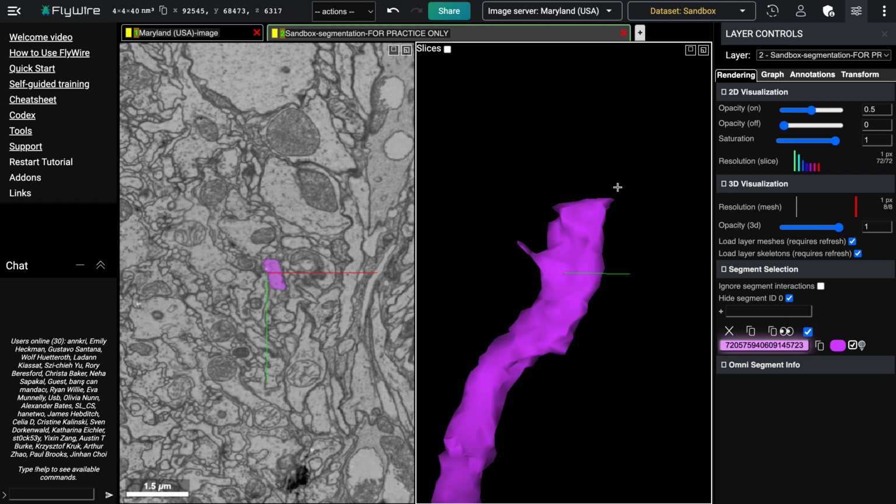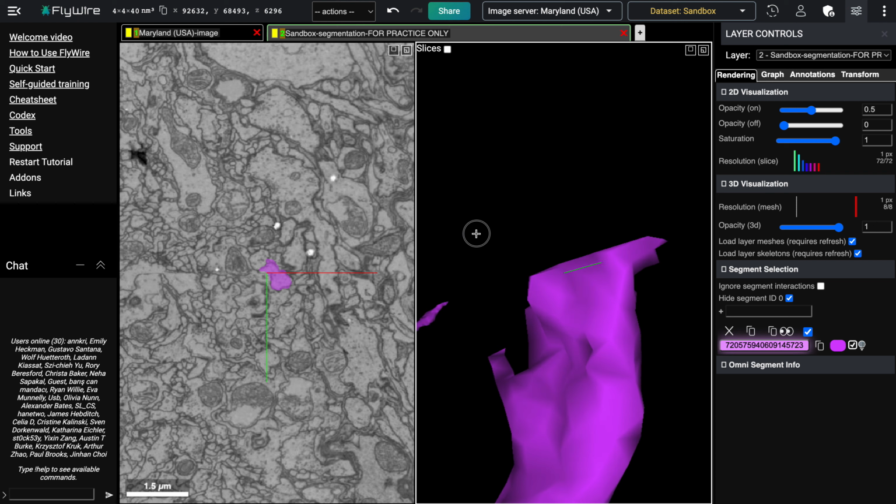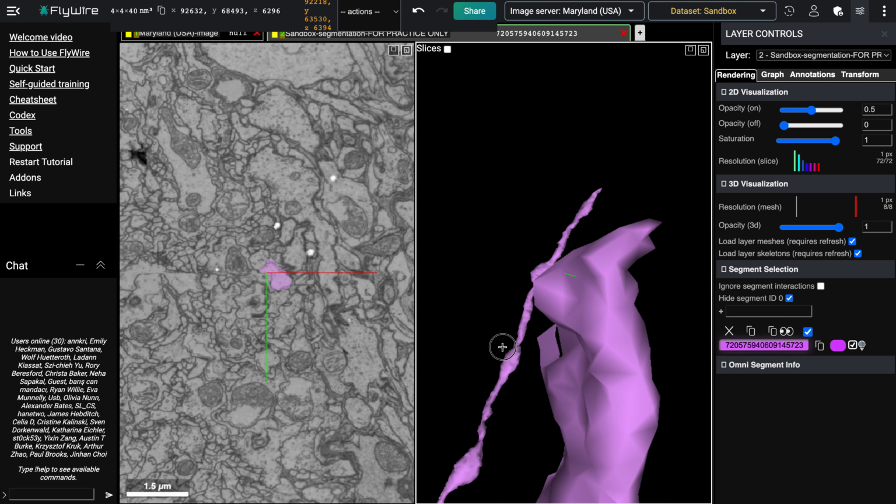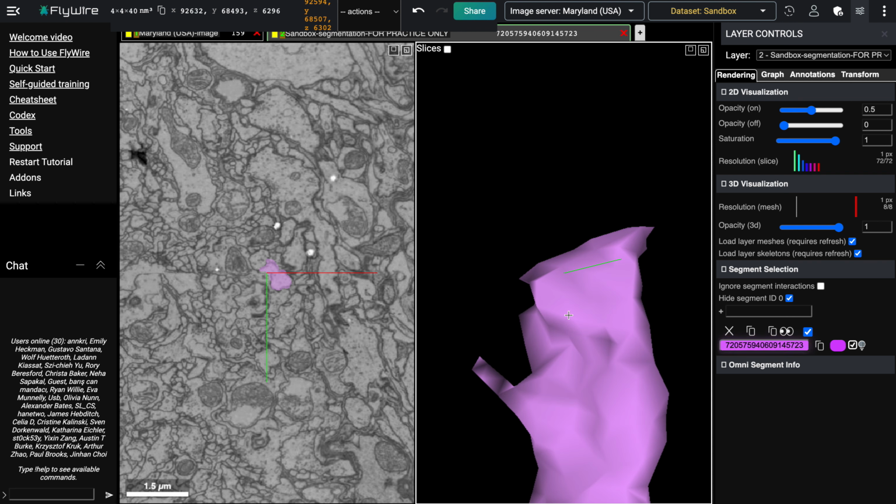Usually branches taper off, and also if we look closer, we can see that it breaks off in this straight line. So that's a pretty good clue that there's an issue and not just a natural ending to the branch.